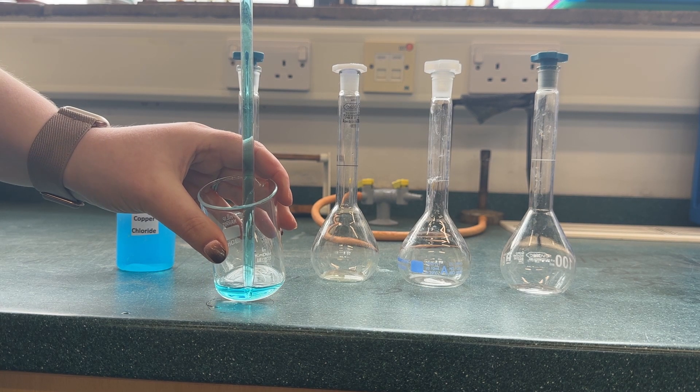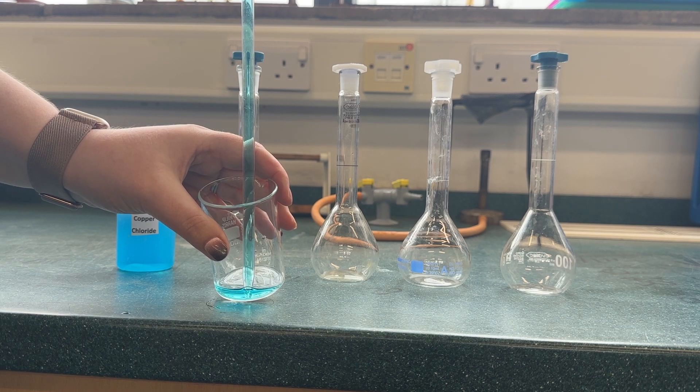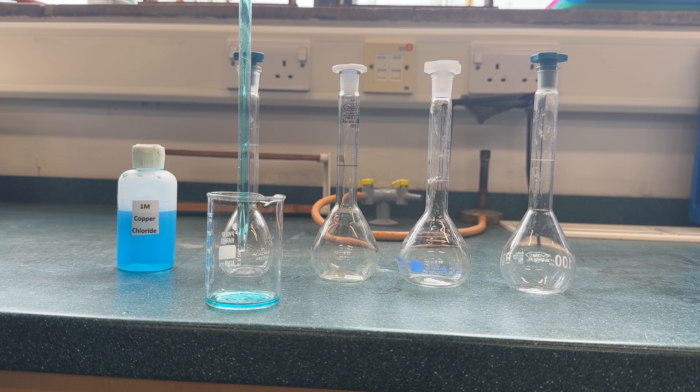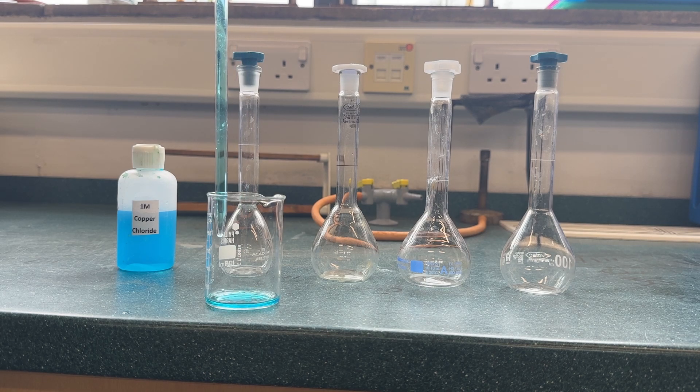After this, we will then take 20 milliliters of this new solution and place it into a second standard flask and dilute to the line. This process will then be repeated twice more.